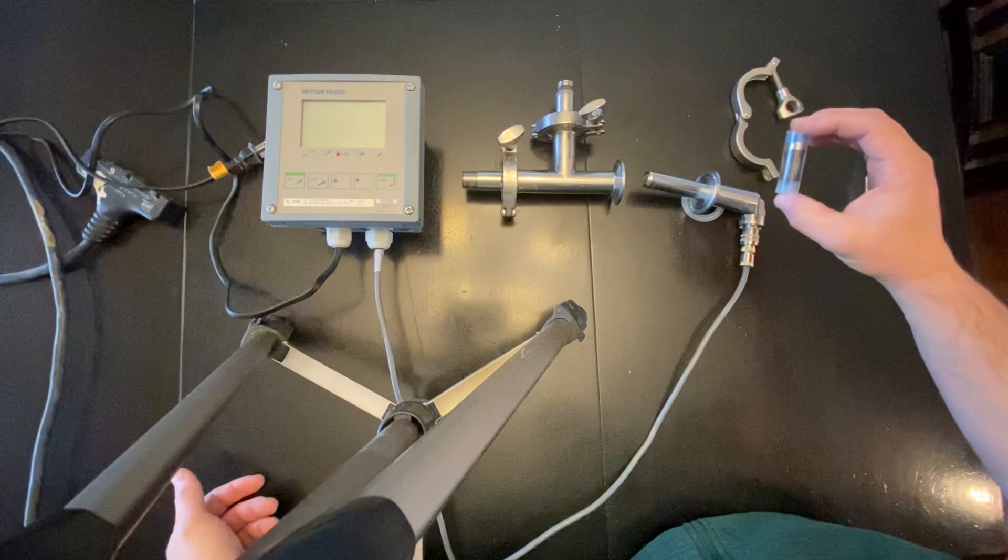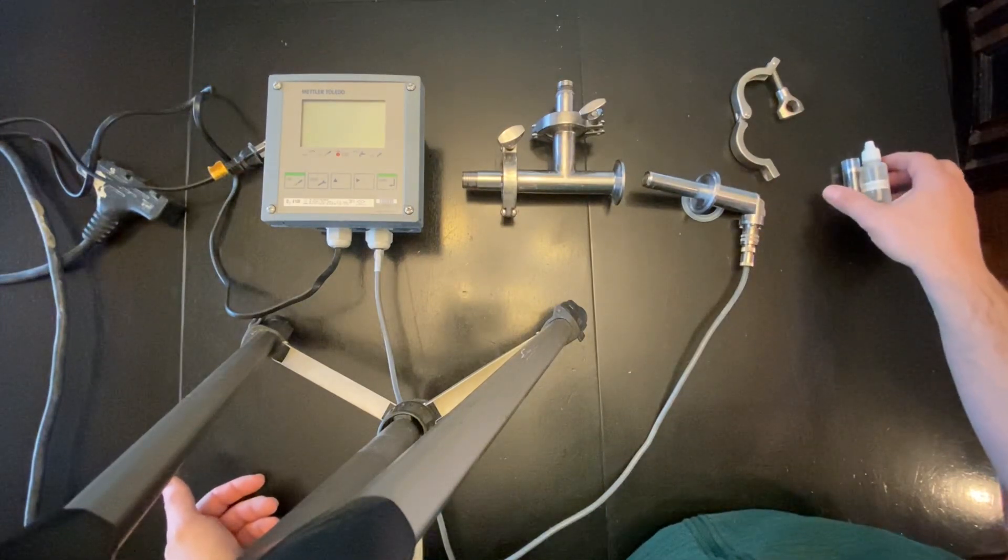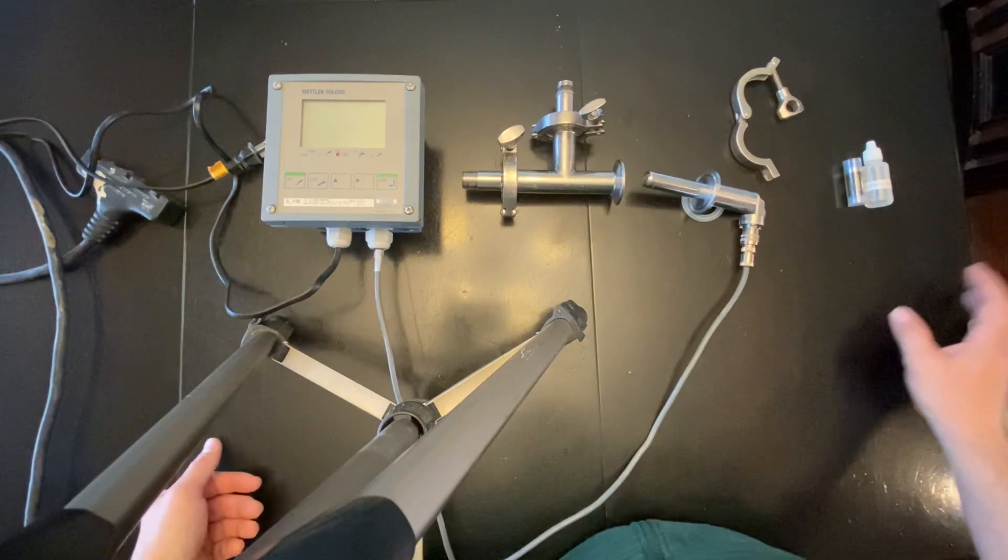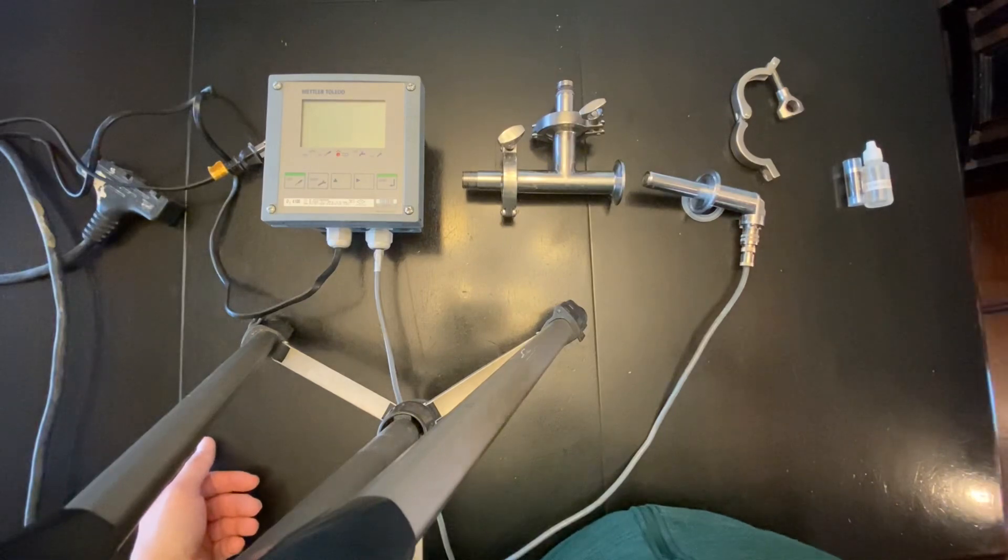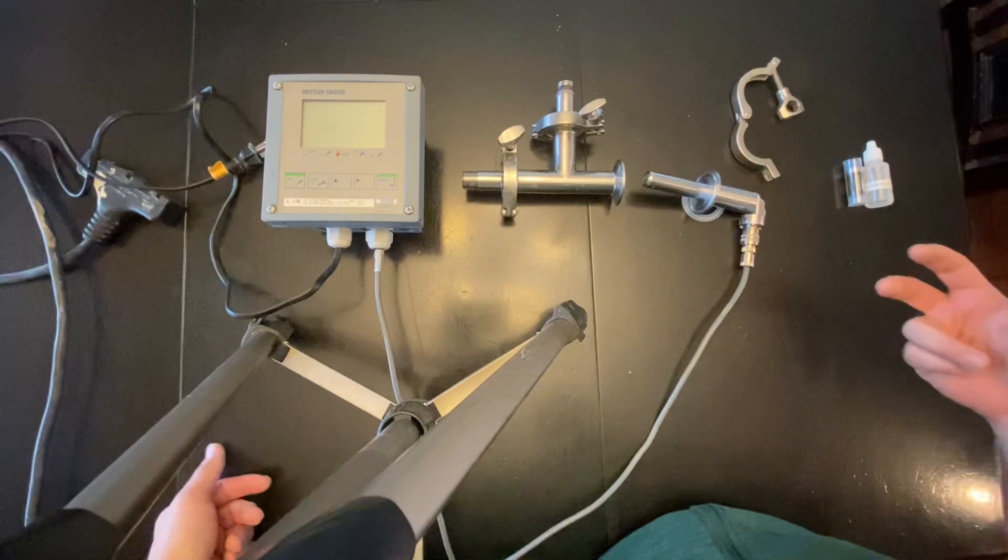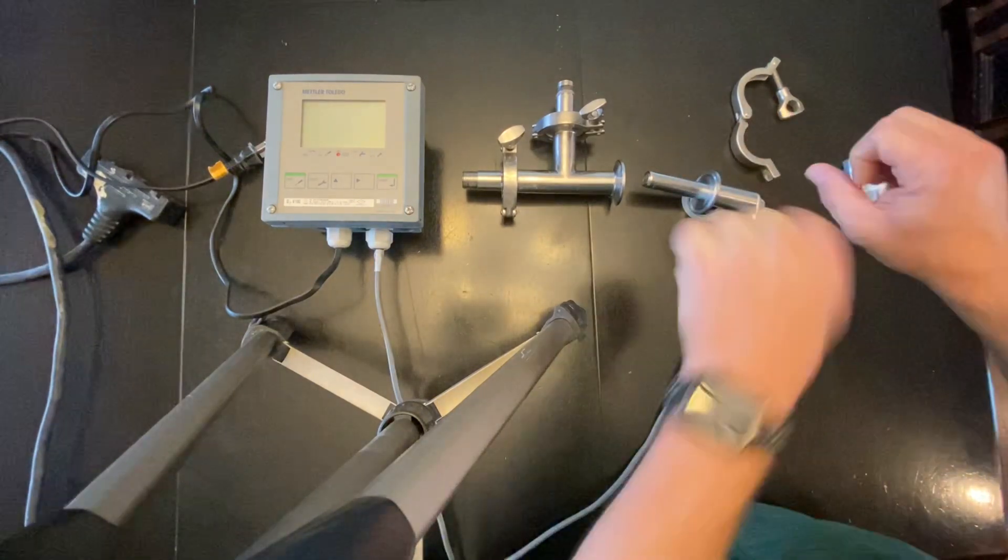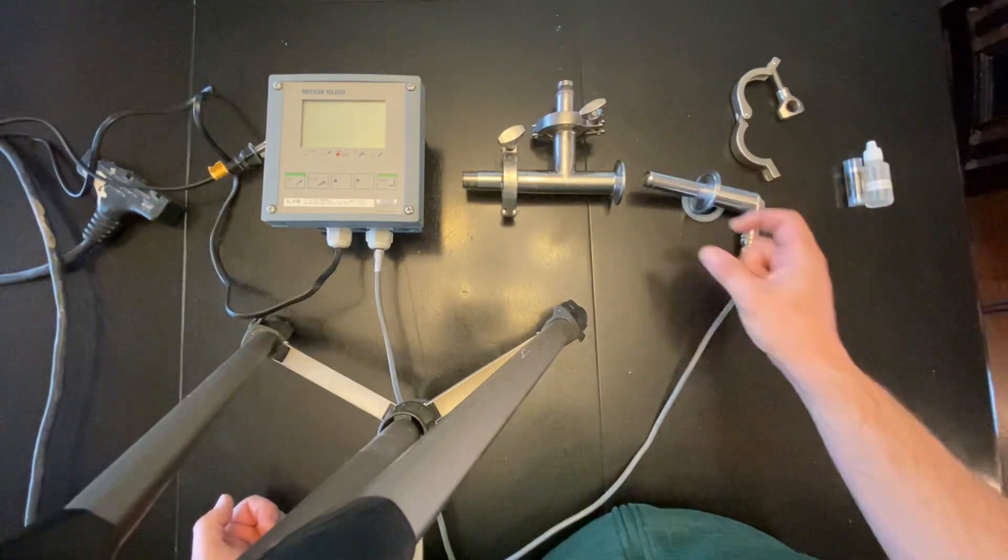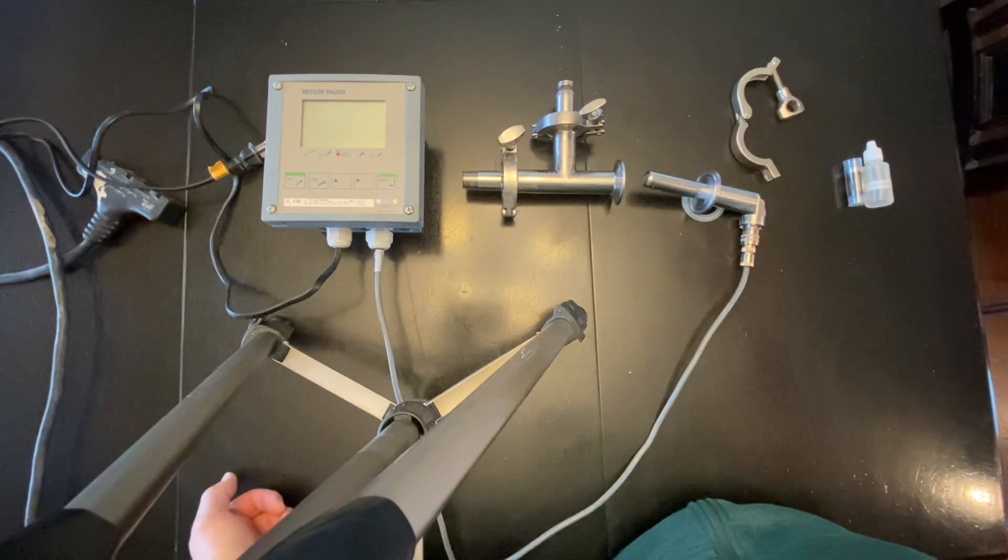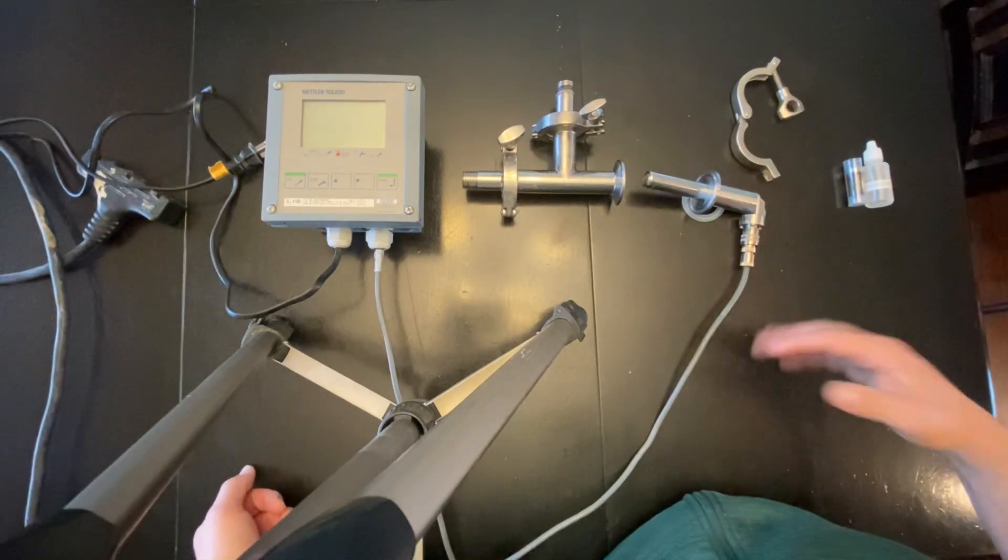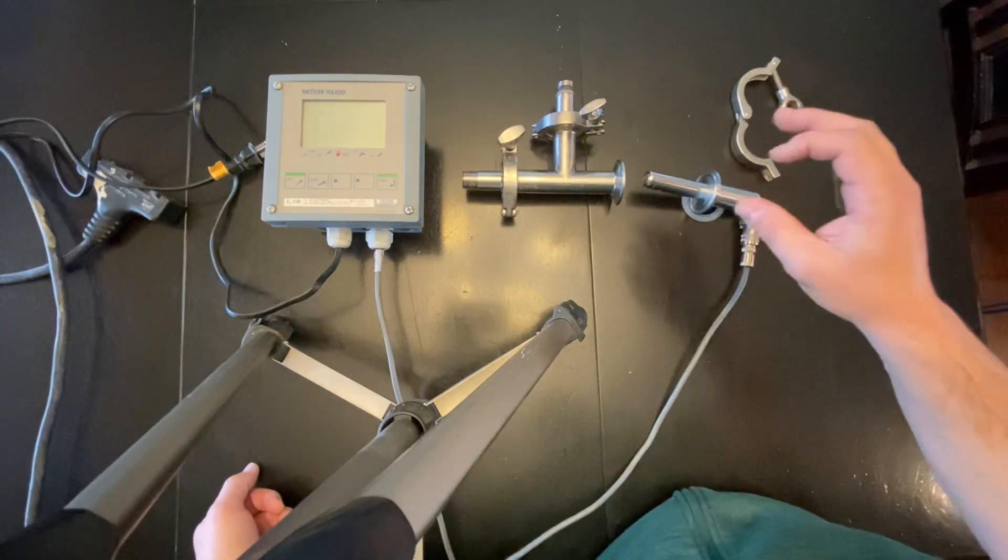I will be including a membrane and solution for if it does get damaged, that way you'll have a membrane and solution. Basically how you do it is you'll unscrew this flange and it'll break about right here. You'll see the little membrane, you'll fill the membrane with solution, tap out the air bubbles, put it back on and do a calibration and it's really fast. These membranes are very durable.